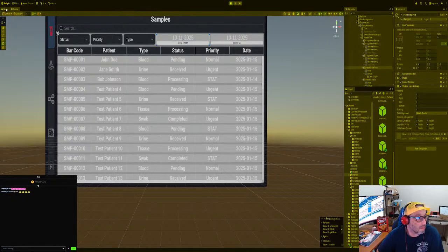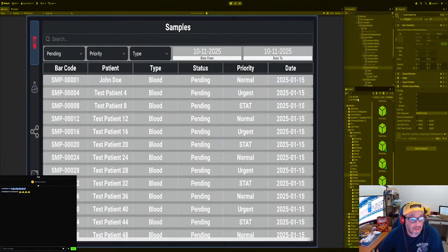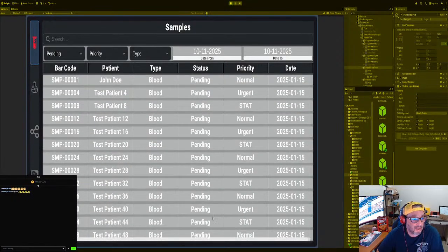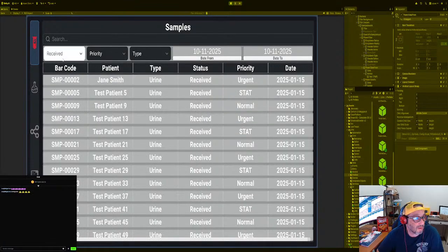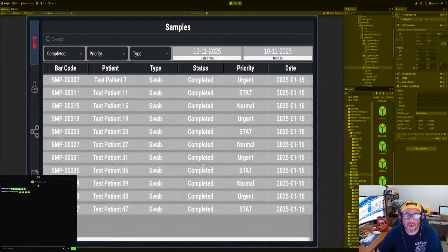Loading, loading, loading. Go here. All statuses. Right? That's what we wanted. Pending. Yeah, it's clearing it out. Right? Pending. Wait a minute. It got pending status. Oh yeah, here goes pending status. And then we want received status. Yes, we have it. Okay, and then we want processing status. Yes, we have it. And then we have completed status. Yes, we do.